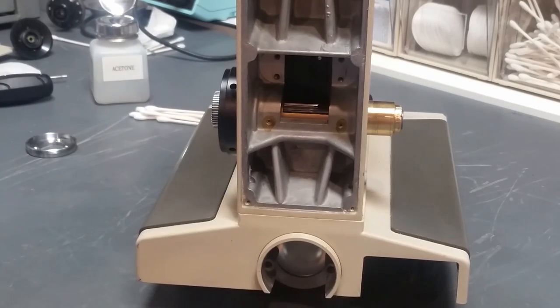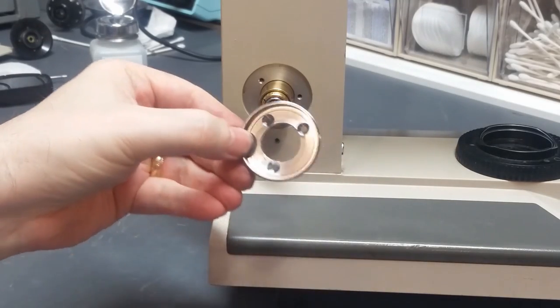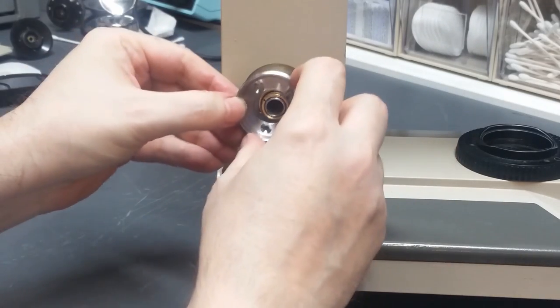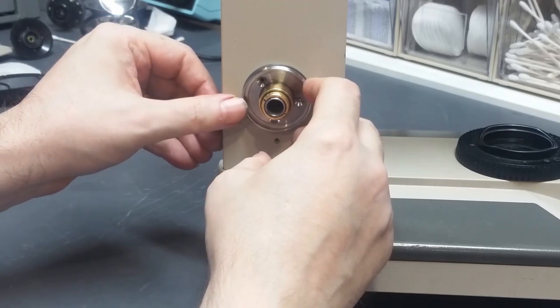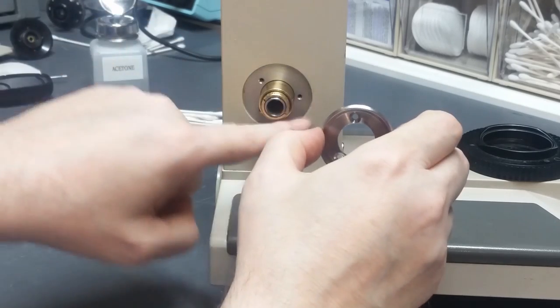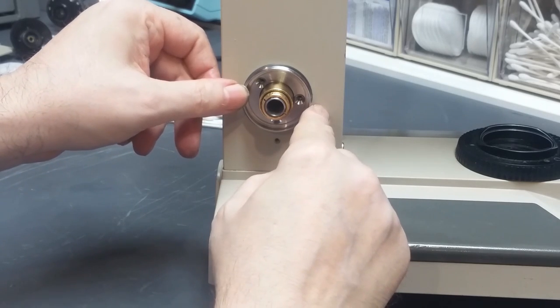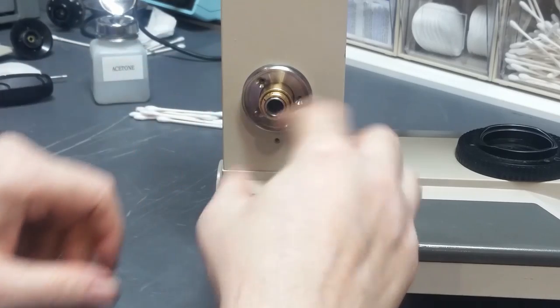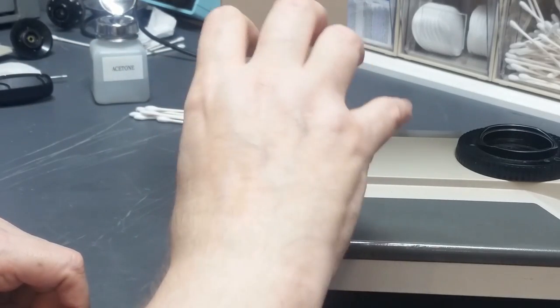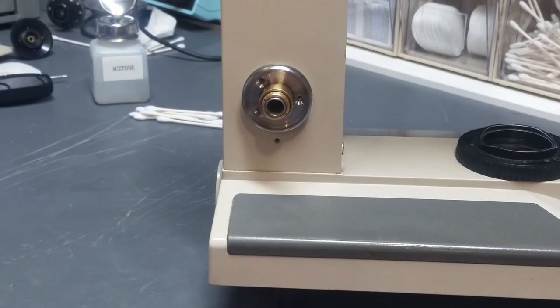Okay, let's rotate this around, and I'm going to install this piece now. It's the lock screw for the preset lock mechanism. These three screws are not symmetrical around there, so you have to make sure that all three holes line up before you start putting your screws in. That was intentionally done so that the knob would come to a certain position relative to the threads.